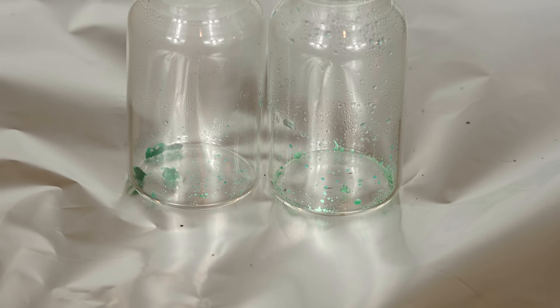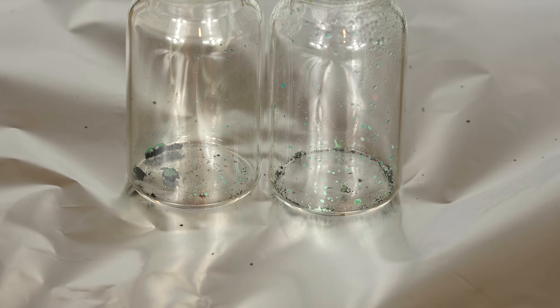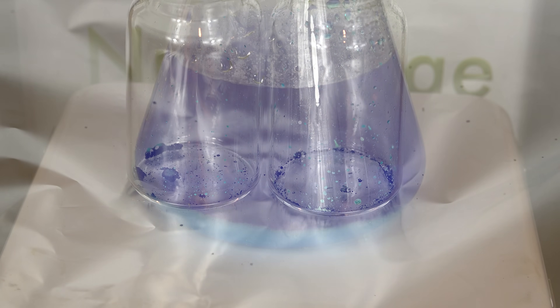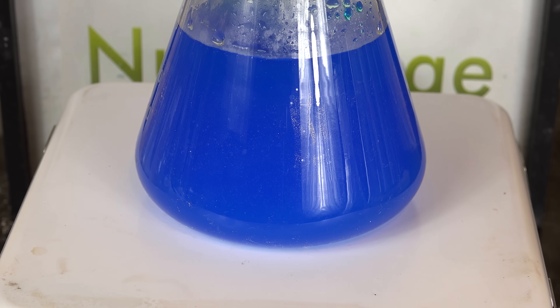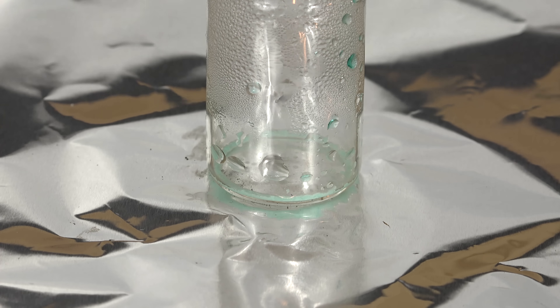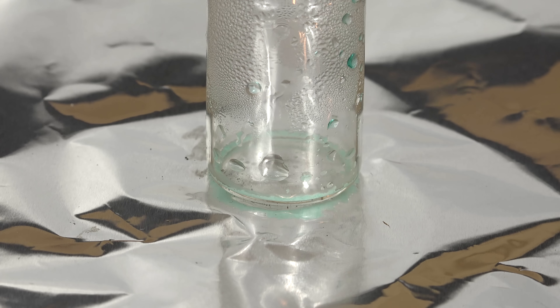If there is insufficient sulfuric acid, then as the copper dries it will turn black as the unreacted copper nitrate decomposes. If this happens, add some more sulfuric acid to your copper nitrate solution and test it again. Don't worry if you use too much sulfuric acid — excess is fine. Eventually it should turn white when heated. This is anhydrous copper sulfate and indicates that we have an excess of sulfuric acid.